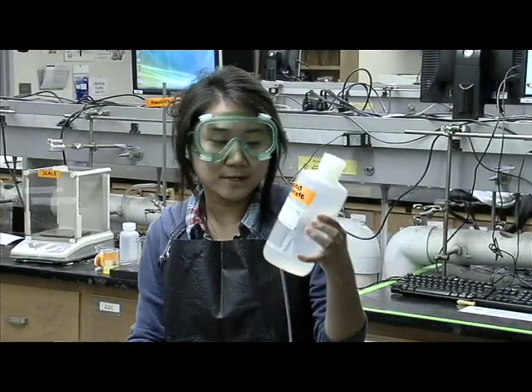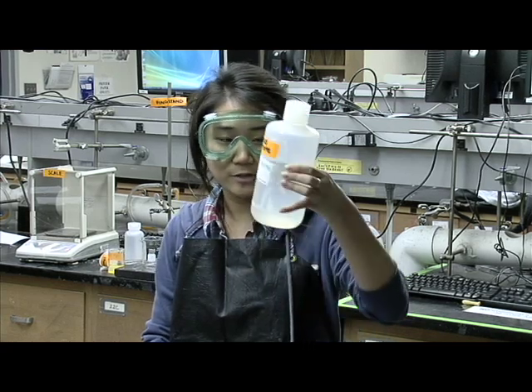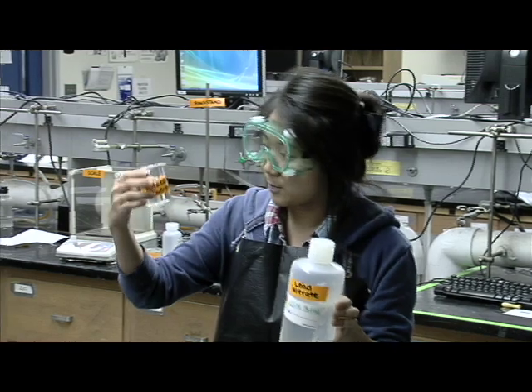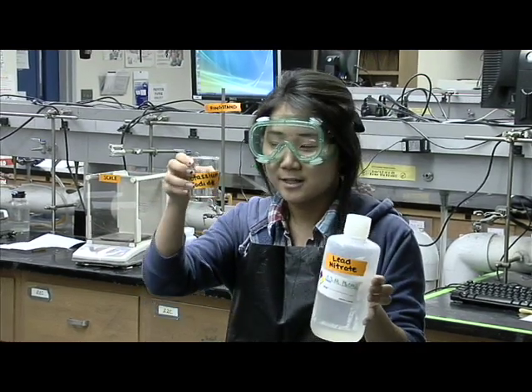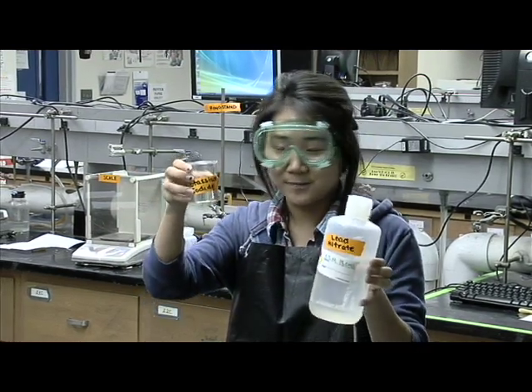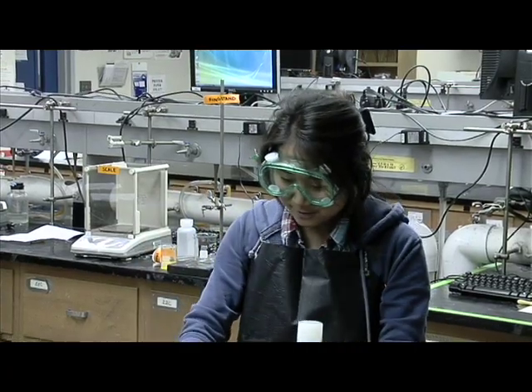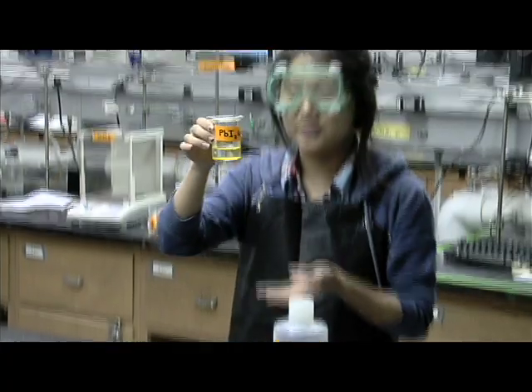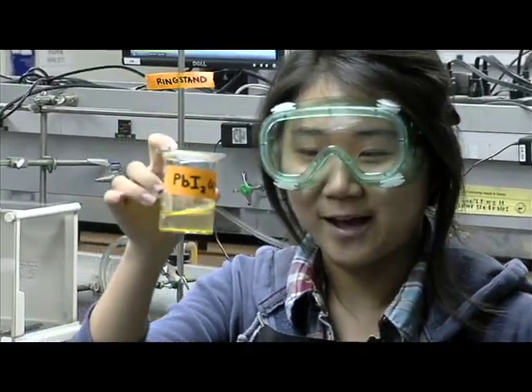We're going to use lead nitrate, which is a clear, transparent liquid, and potassium iodide, which is also clear and transparent. When you mix those two, we're going to get lead iodide, which is yellow-colored and opaque.